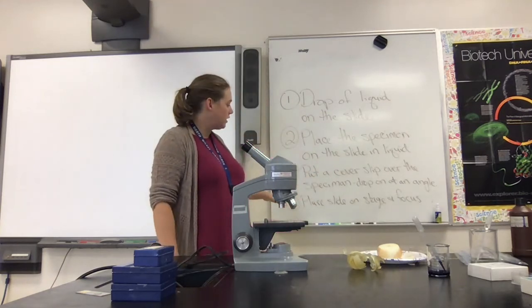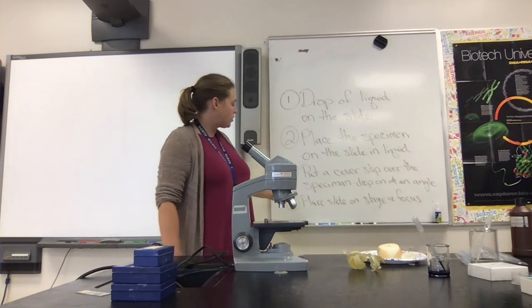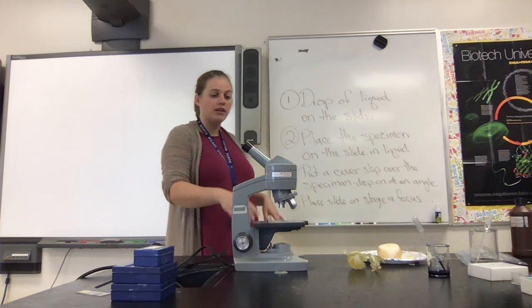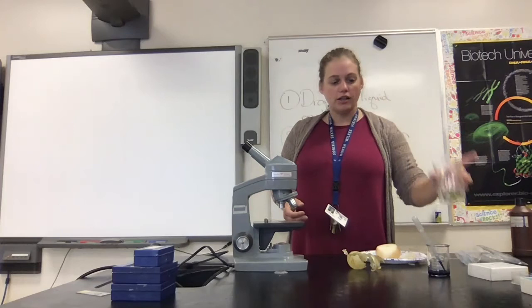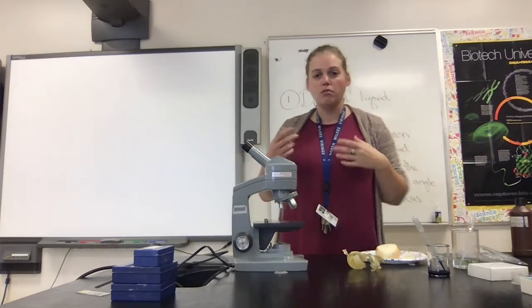We've looked at some slides we made ourselves using the wet mount process. One important thing to note: make sure you dry the excess liquid off of the slide before you put it under the microscope, to protect the lenses from water and chemicals like methylene blue that could damage them. We've made wet mount slides of an onion, a green plant called Elodea, and our own cheek cells dyed with methylene blue. We can also look at preserved organisms.